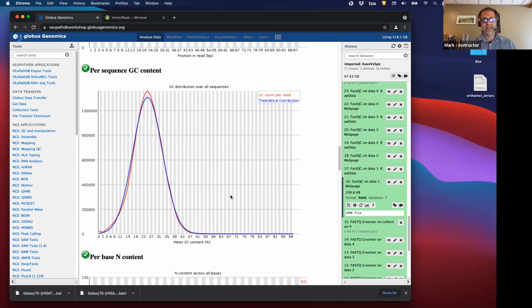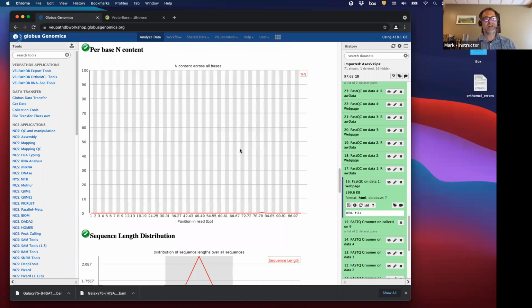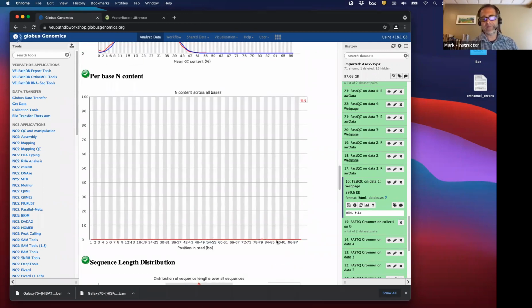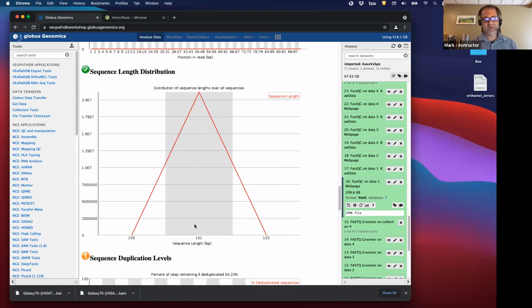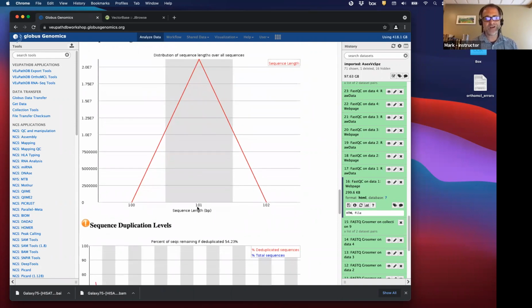Okay, so you can read more about QC. I could go on for hours talking about this, but in general, the quality looks very good for this particular sample. There are no N's, so basically there are very few N's, which is when the sequencer can't make a base call. It doesn't know what base it is. So there are very few of those. That's good. The length of all the reads is 101, as we would expect, because we asked our genome sequencing center and we paid for 101 nucleotide reads.